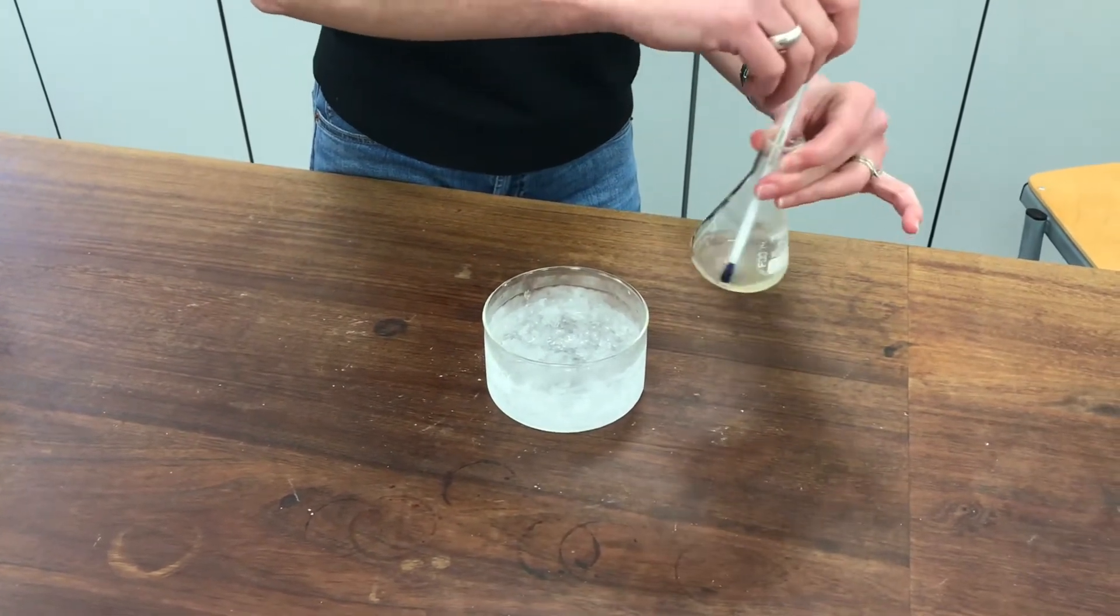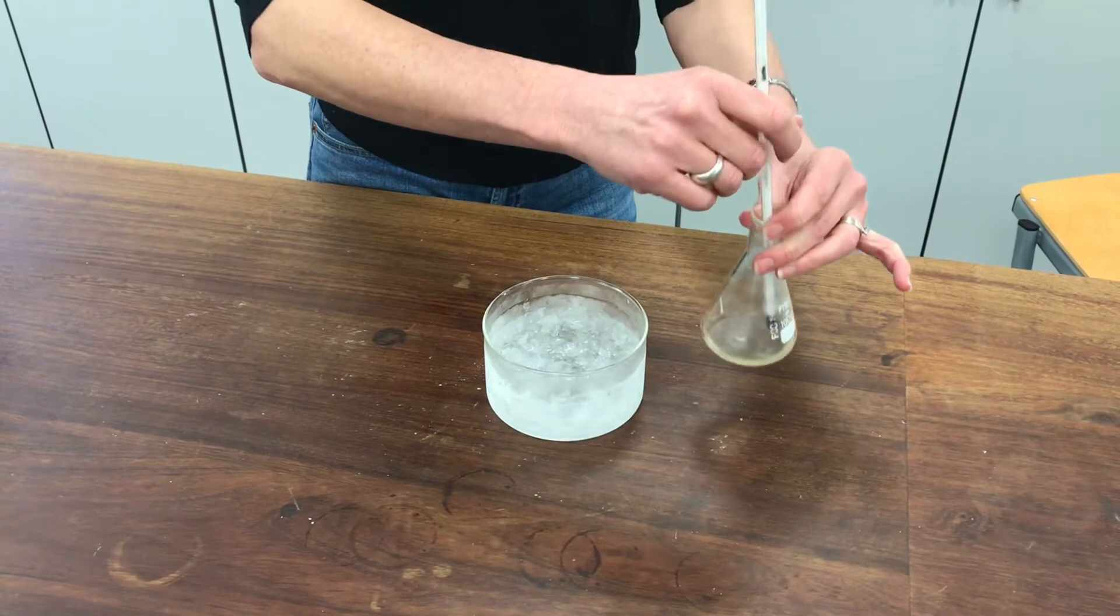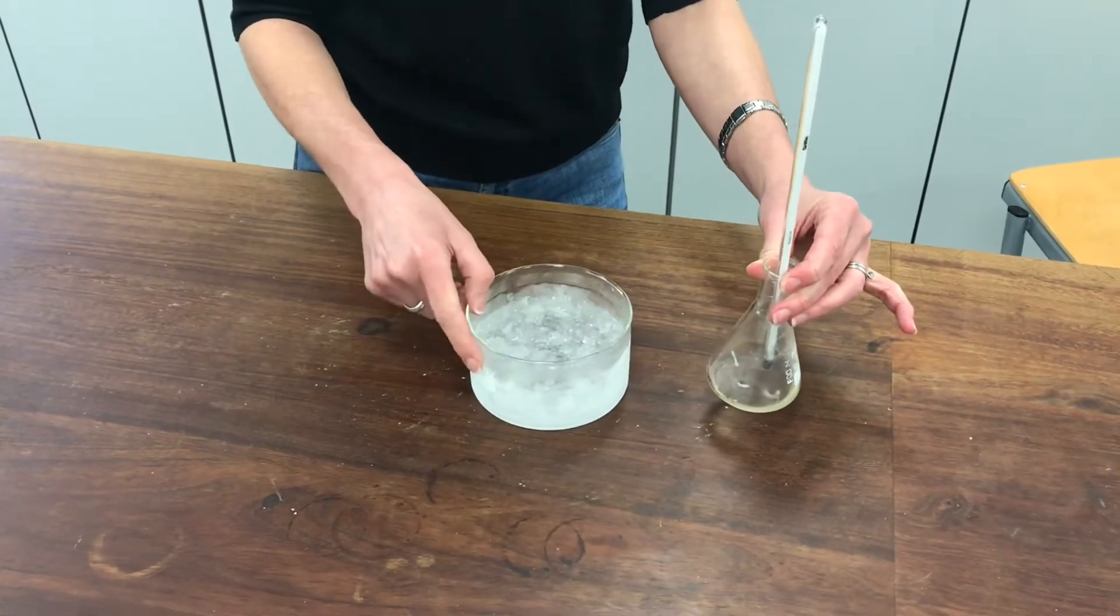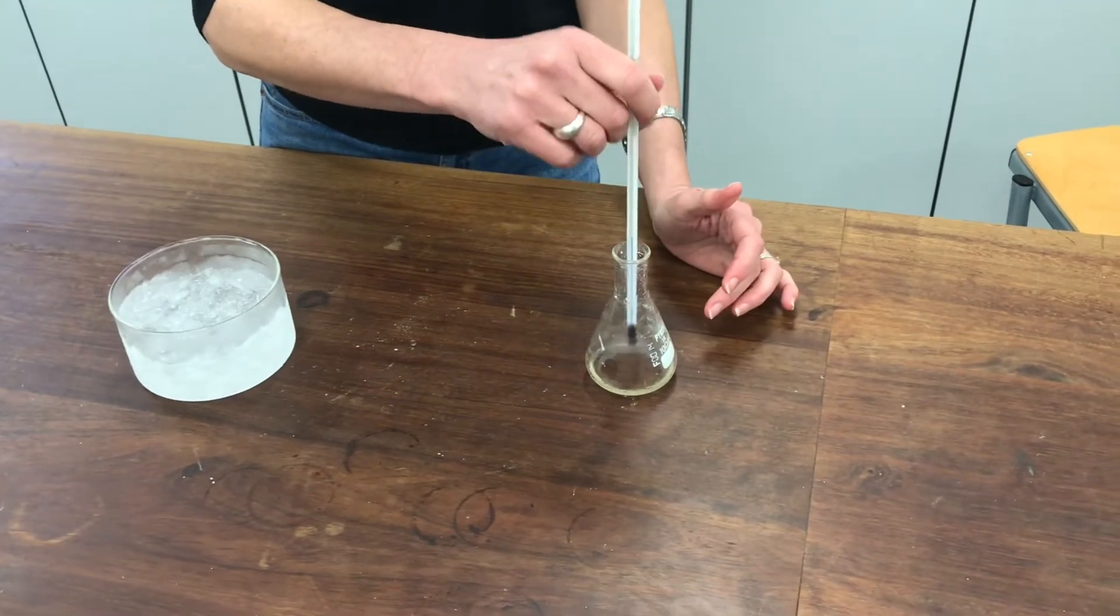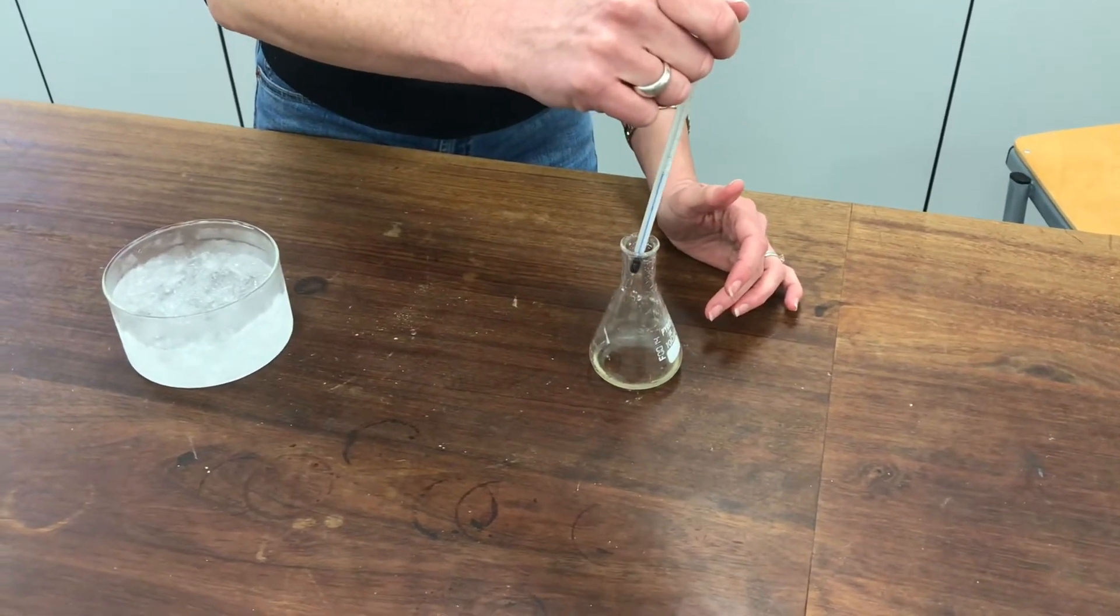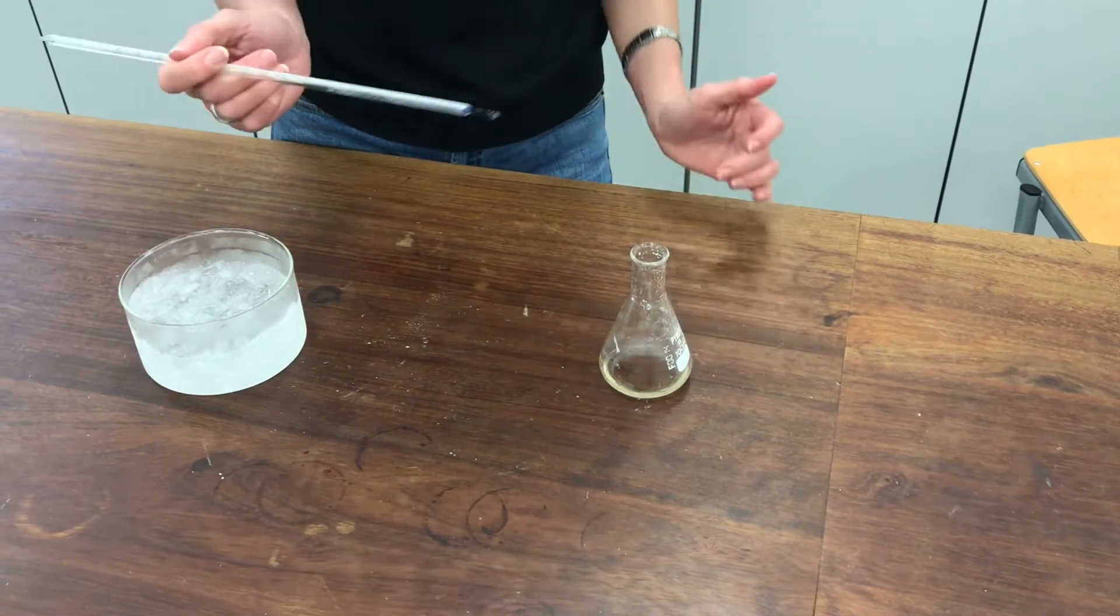And it's got a kind of yellow tinge to it as well. The next stage of the reaction is I need to leave this to stand at room temperature for 15 minutes. I'm just going to leave this here on the bench. I don't think we need to film and watch all of that. But we'll come back in 15 minutes and have a look at it then.